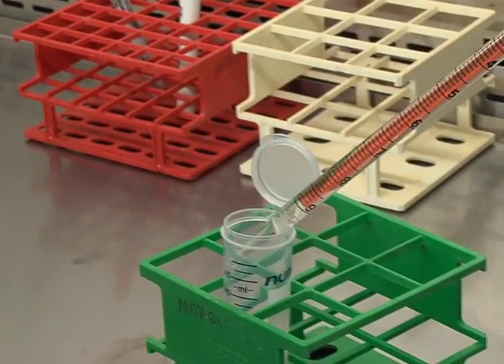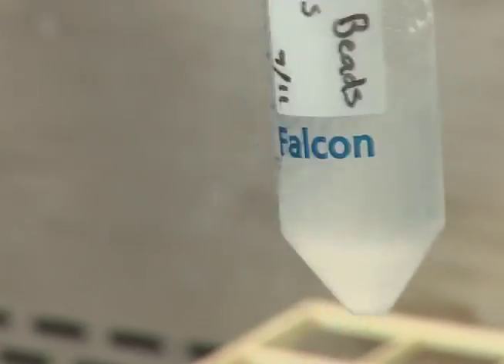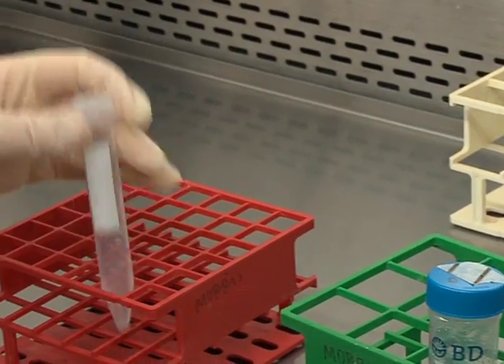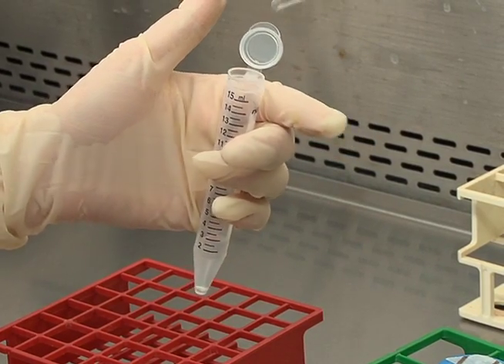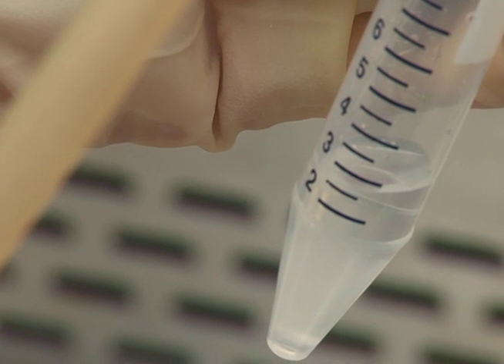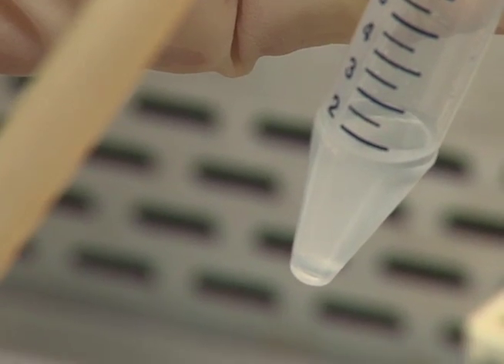Now harvest an 80% confluent culture of extravillous trophoblast cells using trypsin digestion. Gently mix the prepared Cytodex-3 beads and, using a wide-tipped 10-milliliter serological pipette, transfer 2.5 milliliters to a 15-milliliter conical tube. After the Cytodex-3 beads have settled to the bottom of the tube, pipette off the top layer of DPBS without disturbing the Cytodex-3 beads.